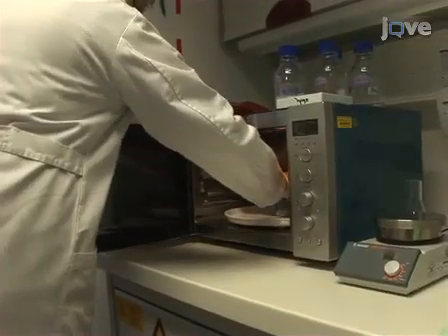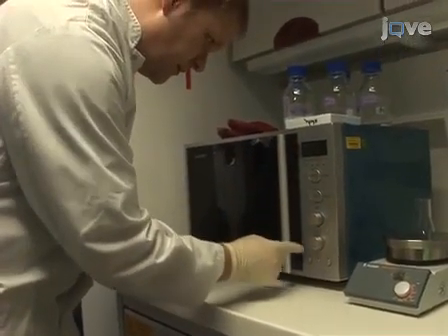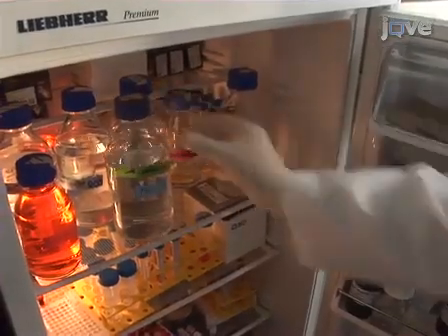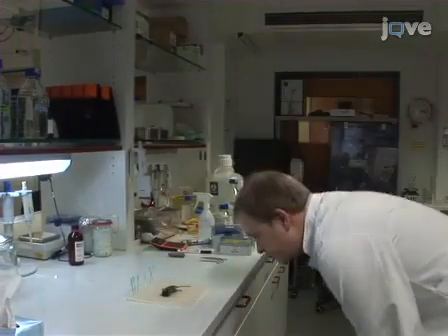Just before the end of the infection period, melt 20 milliliters of low-melting agarose in a microwave and keep it warm so that the agarose does not solidify before it is injected. Chill a bottle of PBS to 4 degrees Celsius in the refrigerator at this time as well. At the very end of the infection period, the animal is euthanized.